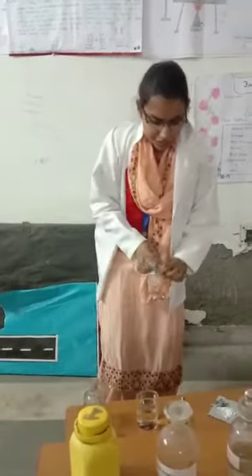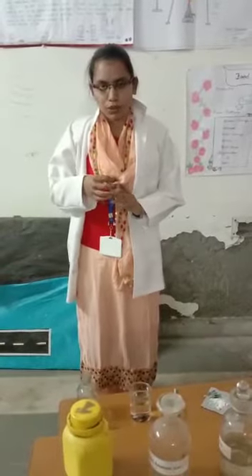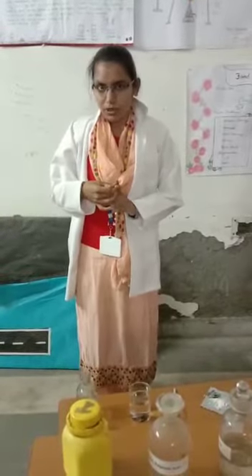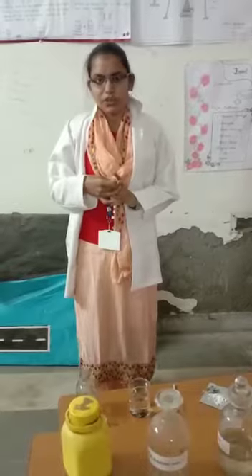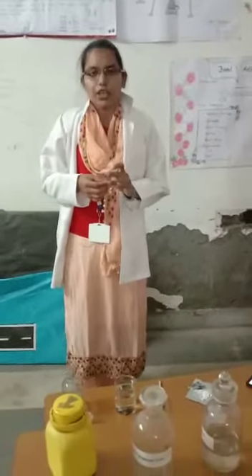This is the qualitative test for CaSO4. We used dilute H2SO4, concentrated H2SO4, acetic acid, and ammonium oxalate. Thank you.